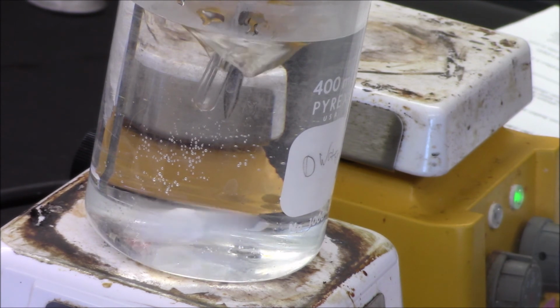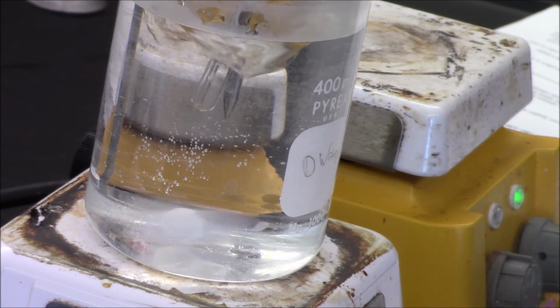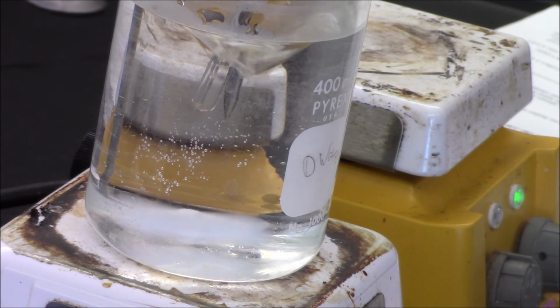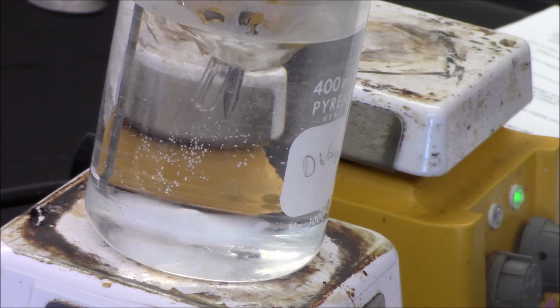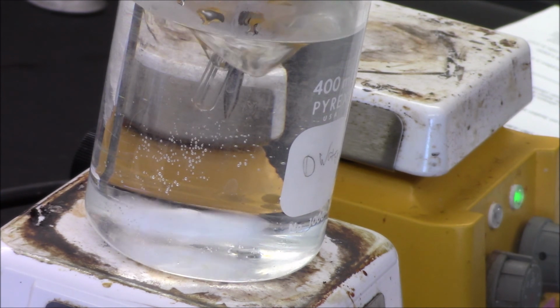53.7, still boiling. Keeping my fingers crossed that it boils at the right temperature. I think I did a pretty decent job at getting rid of the aqueous phase, so it shouldn't be a mixture, but that would play a role if you were looking to discuss error. If I had some aqueous phase in there, it would definitely affect my boiling point. I'm down to almost 53. It's 53.1. Seems to be decreasing at a better rate now, 53.0.